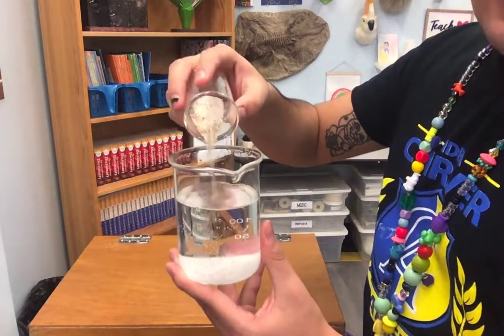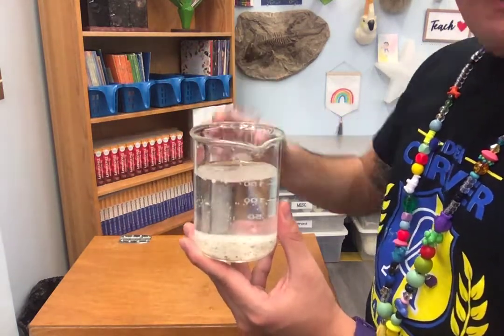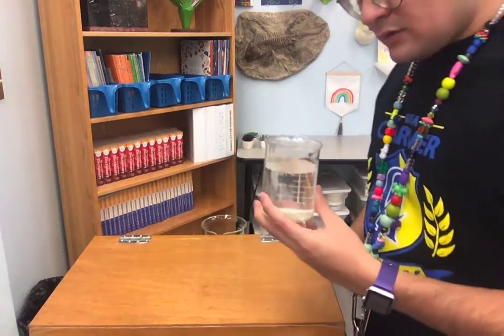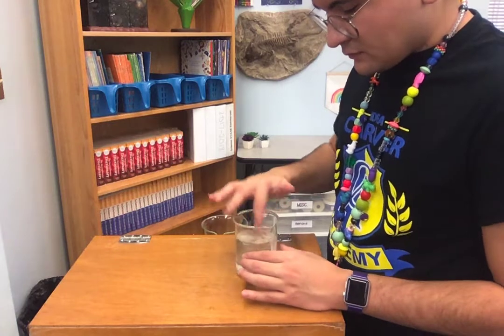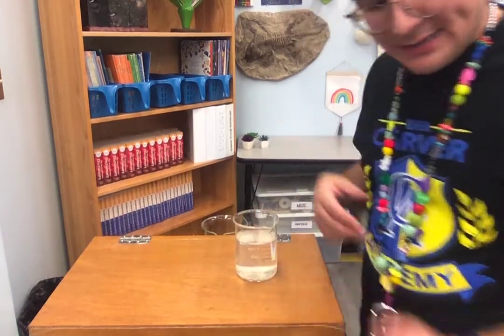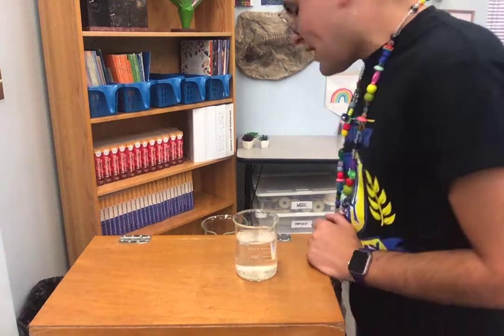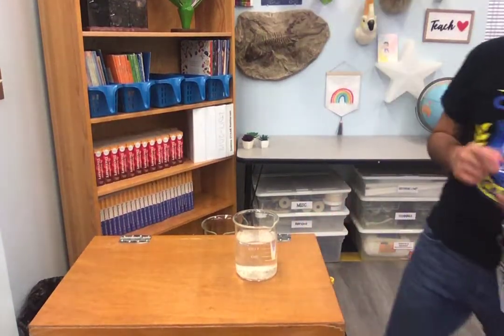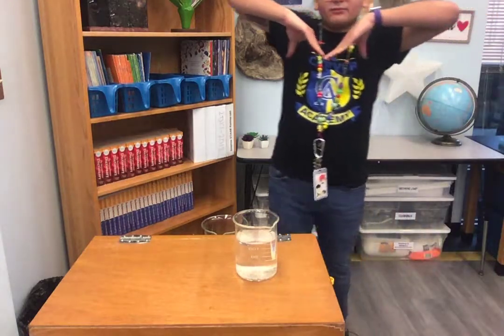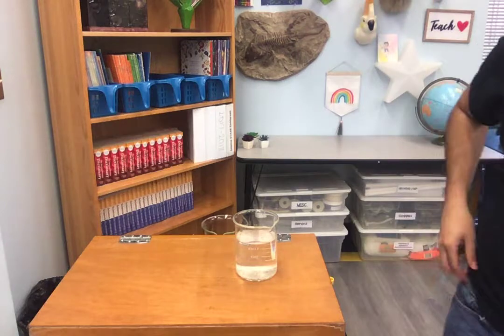Oh, I've got to be careful. Ready? Watch where it lands, if it floats or if it sinks. Ready? 1, 2, 3. I'm seeing something happen that happened to the salt. What's happening, everyone? Why is it going down? You're right. It's sinking because it is. Oh, I'm not going to say it, but write it down. Is it more dense or is it less dense because it sinks? Remember, M for more dense, we go down. L for less dense, we go up.